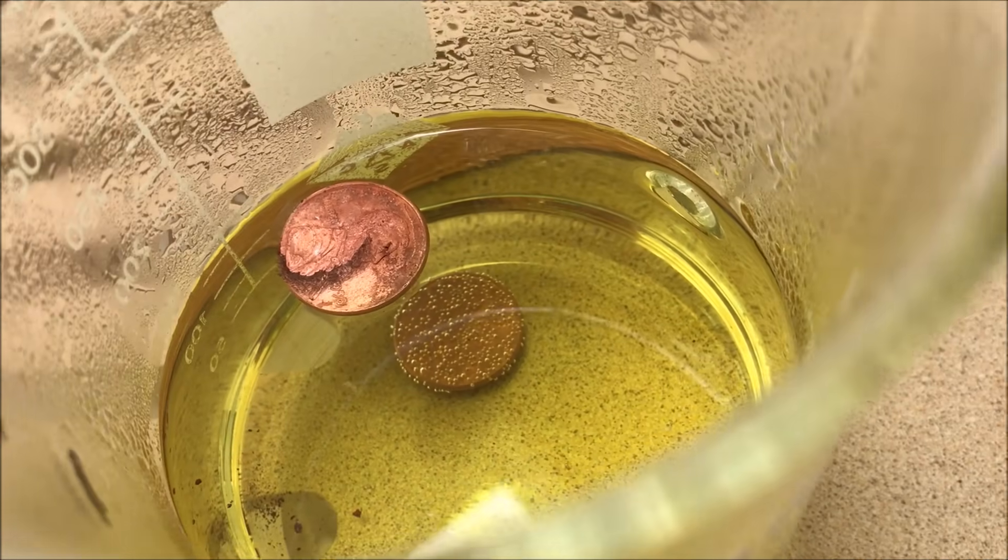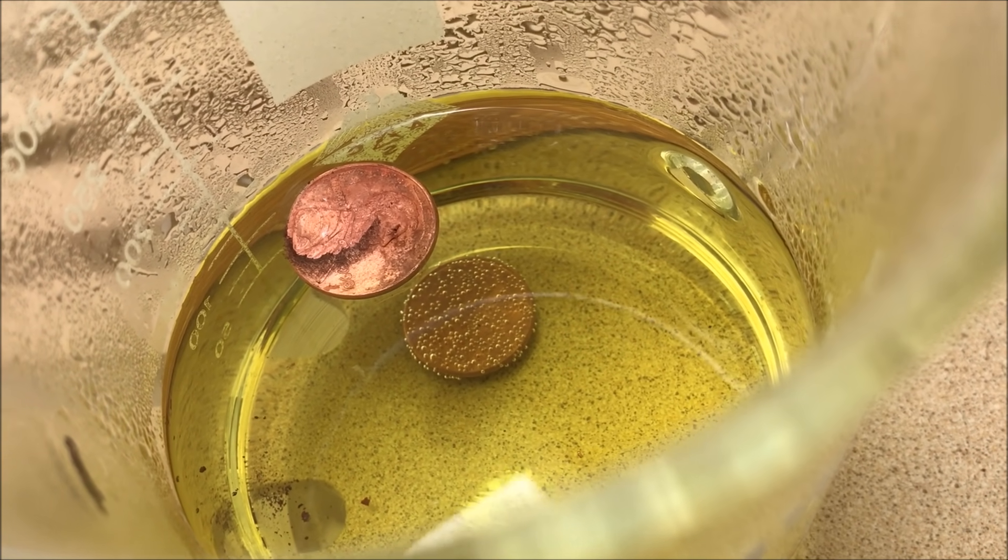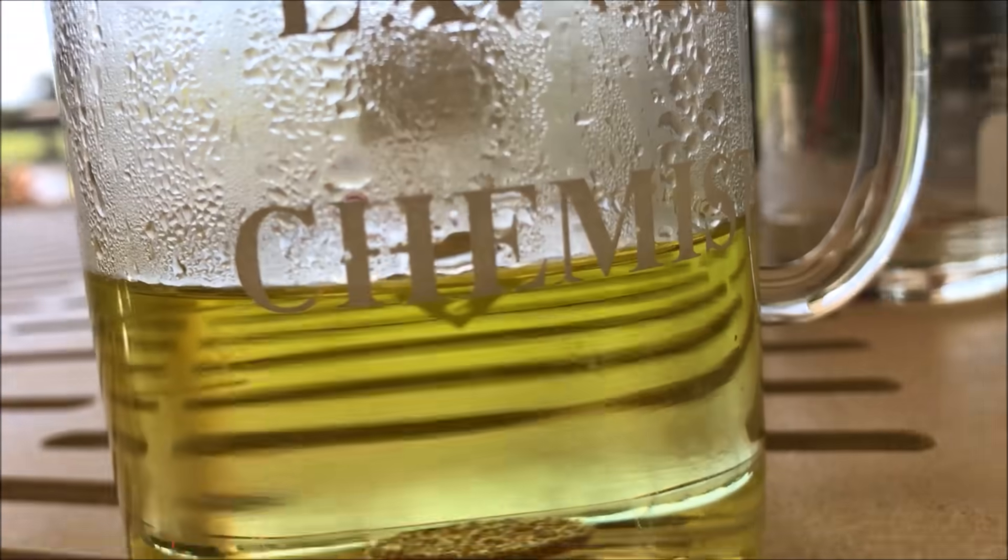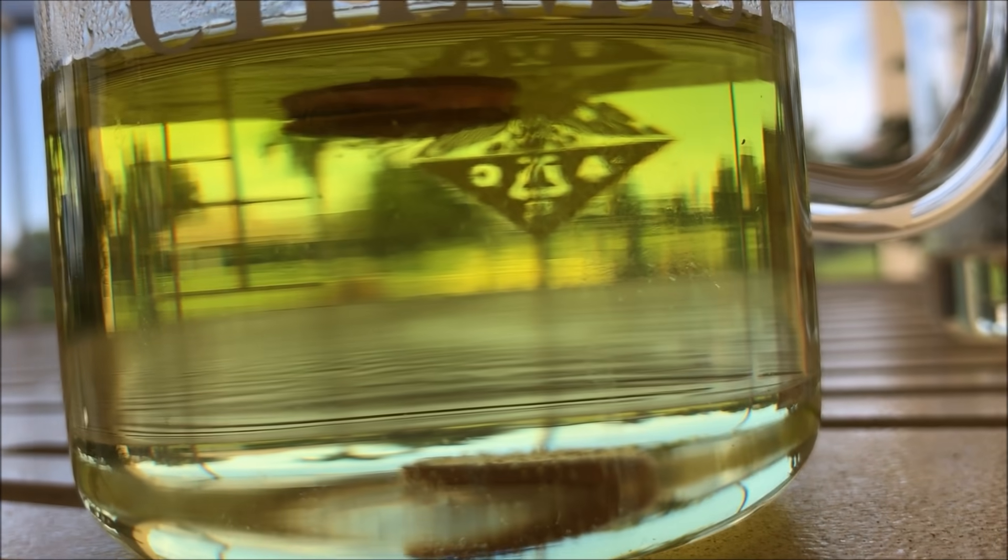It's the next morning and we see that the penny that had the zinc in it is floating. I'm going to give you a side view. You can see the penny is floating. The other one is at the bottom.